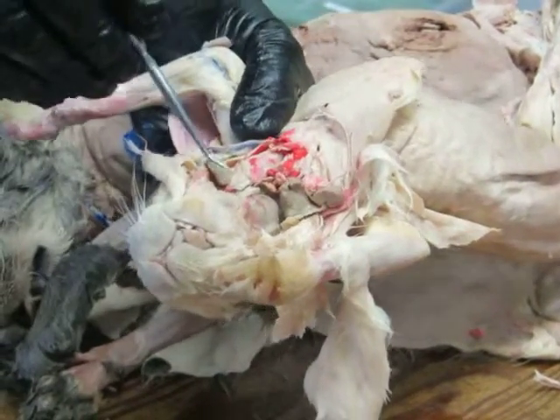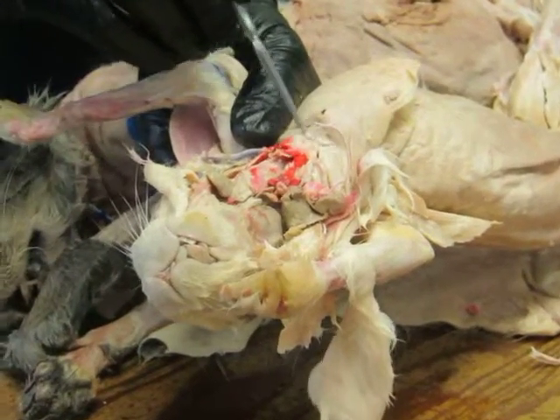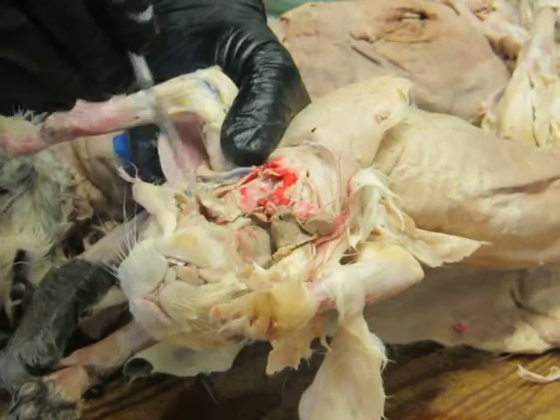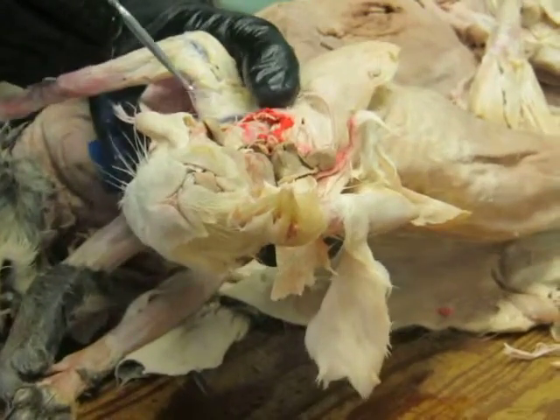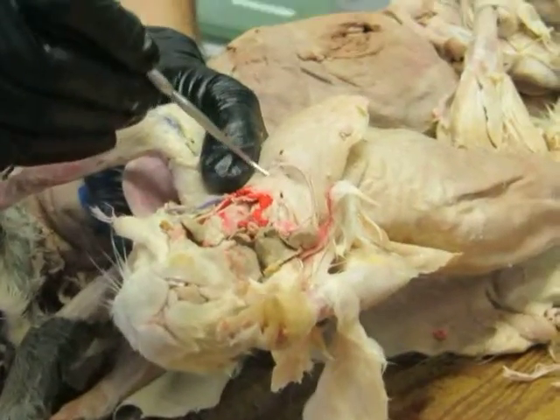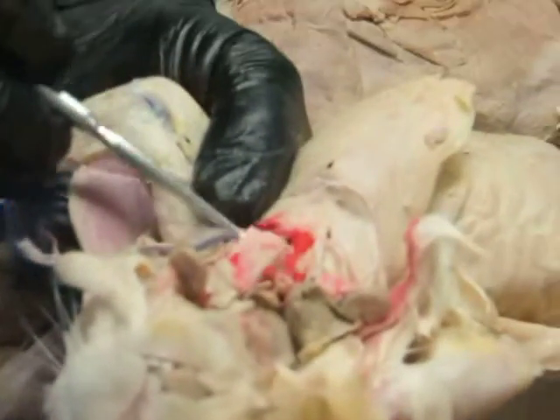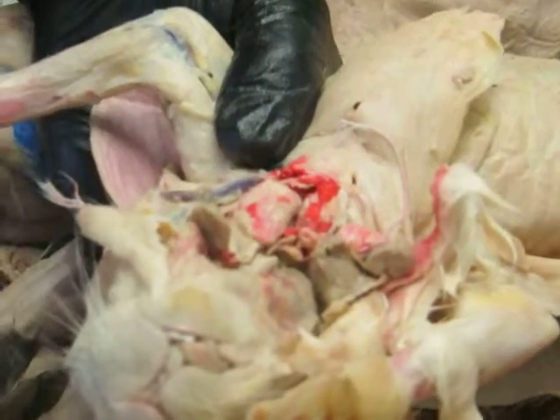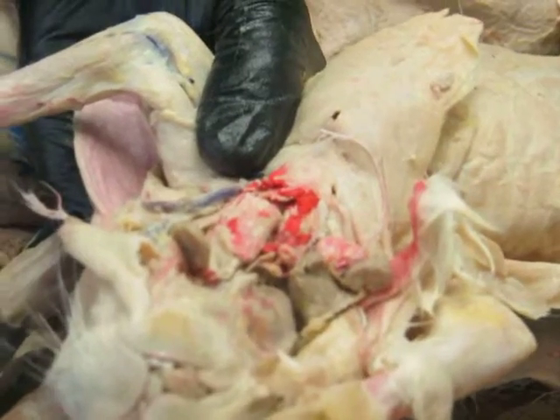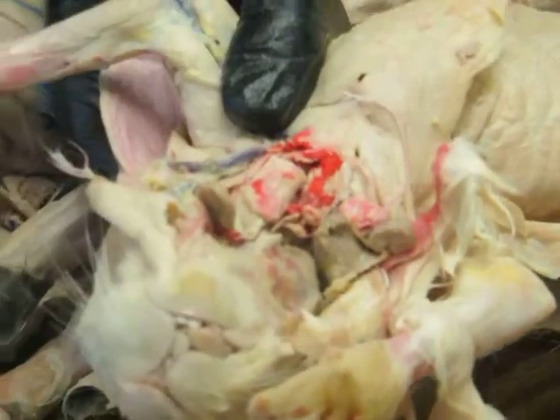So hypobranchial muscles, remember, are going to be the muscles that are involved in coming between the sternum and the inside of the lower jaw, running in this region. And the most prominent ones you'll see are a pair of muscles that come from the sternum and run up to the hyoid bone, and those are called the sternohyoids. And that's this guy here. Okay. Those basically are involved in pulling the hyoid down, which is retracting the tongue. So if the hyoid gets pulled back or caudally, that's pulling the tongue back into the mouth.